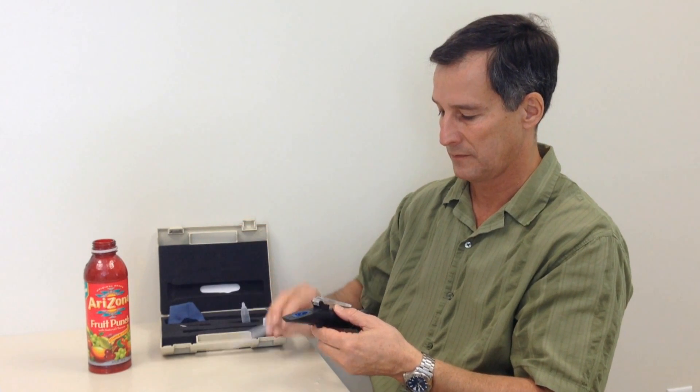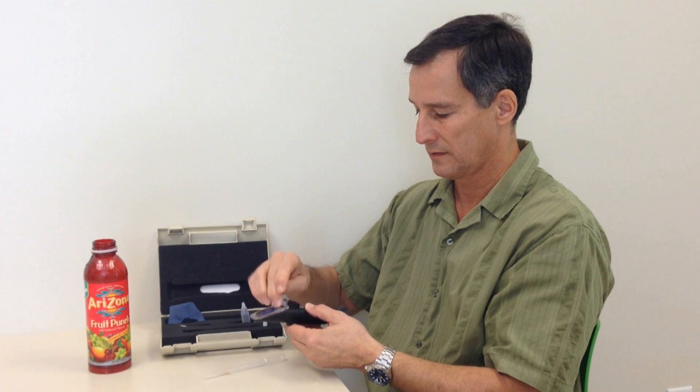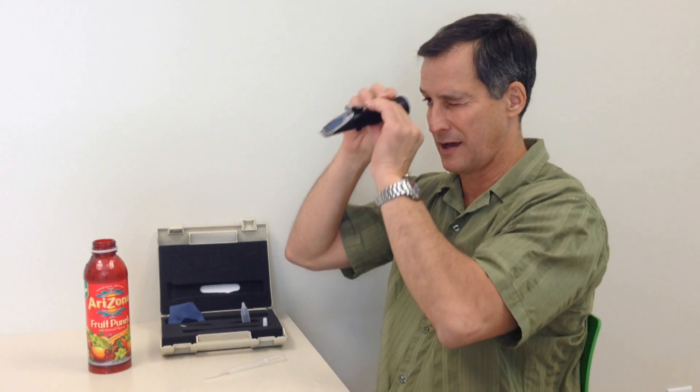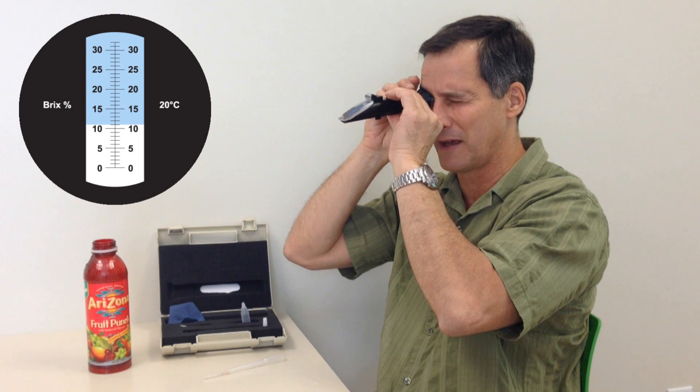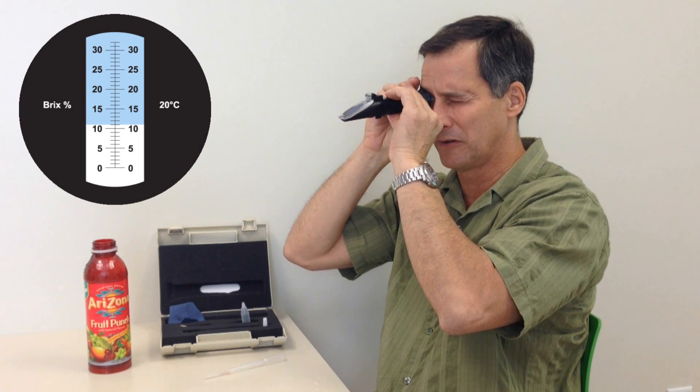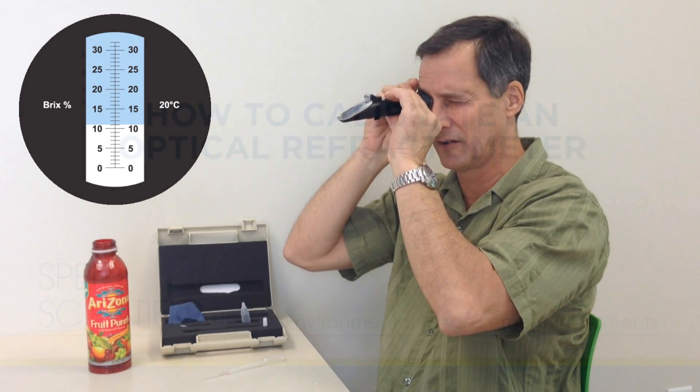I read the results. In this case, it indicates that there's about 11% sugar in this solution.